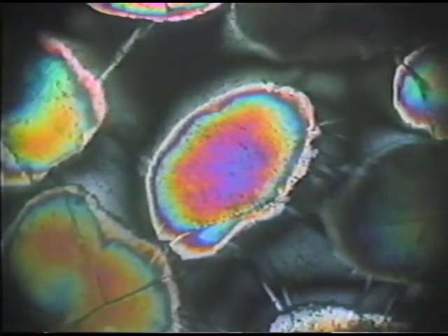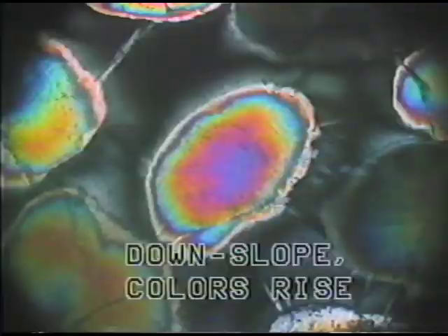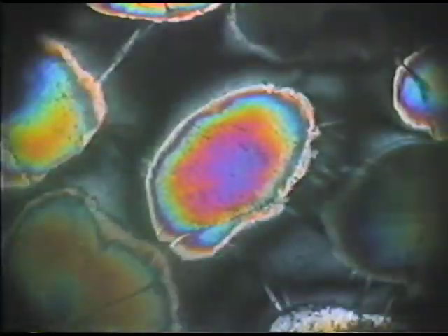And I'm inserting the quartz wedge now, pulling it out, inserting it again, and the colors are moving out of the grain down slope. In this kind of situation, we say that the colors are rising as I insert the quartz wedge, and this is an indication then that the slow ray in this particular quartz grain is now parallel to the slow ray in the accessory plate.